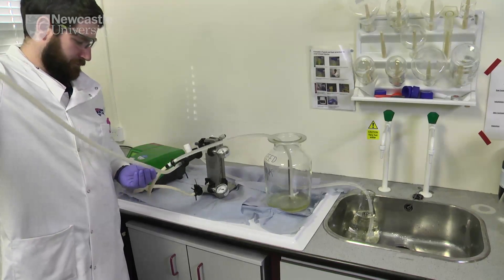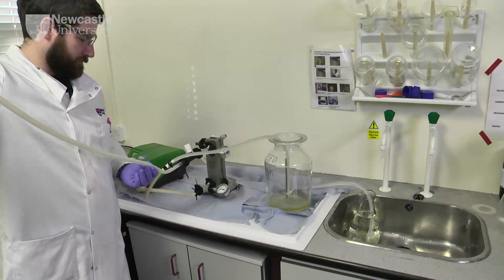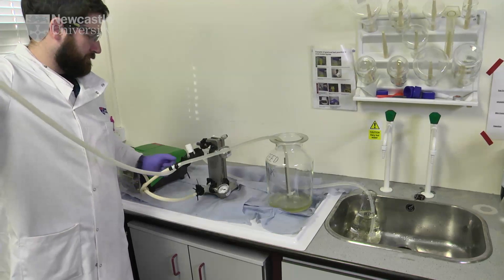Finally, the retentate valve is opened and any solution remaining in the retentate line is collected.